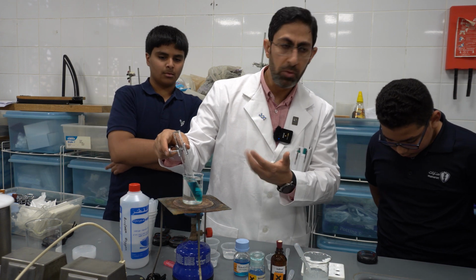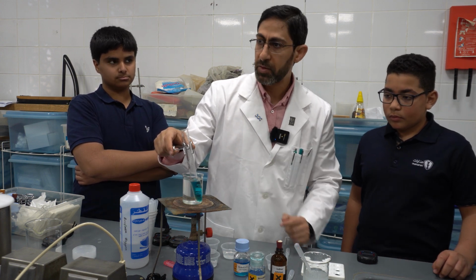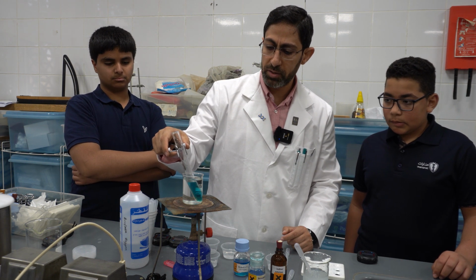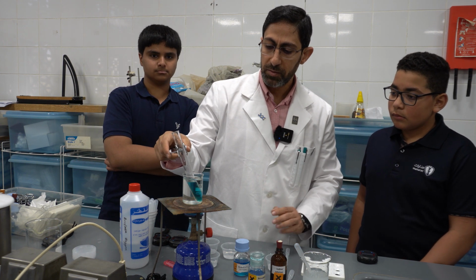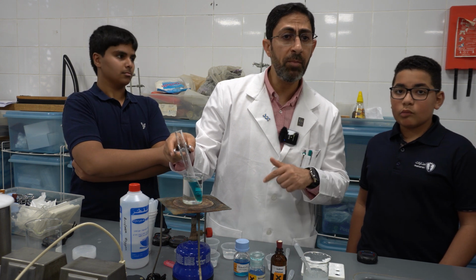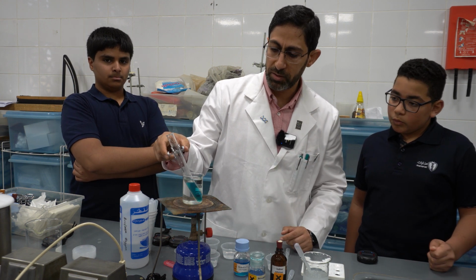And now the solution is being warmed, so it will take a little bit of time. It is much safer to use a water bath, not the direct flame. I think in a couple of seconds it will work. This is the last test, in order to confirm the presence of the reducing sugar, which indicates that the enzyme amylase already digested, or broke down, all of the starch, which is the polysaccharide.